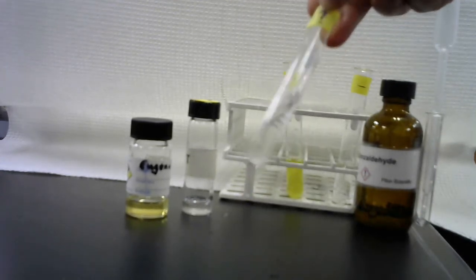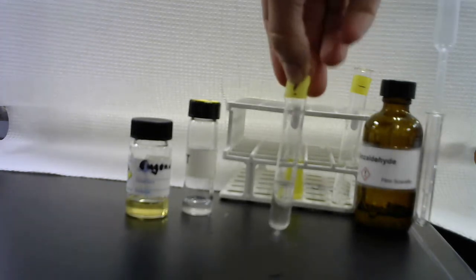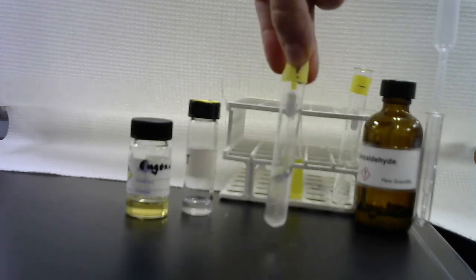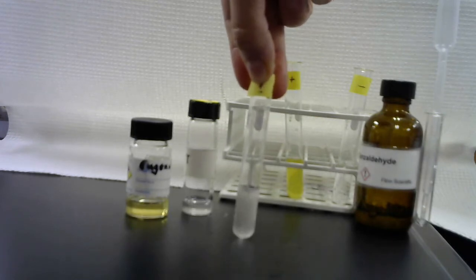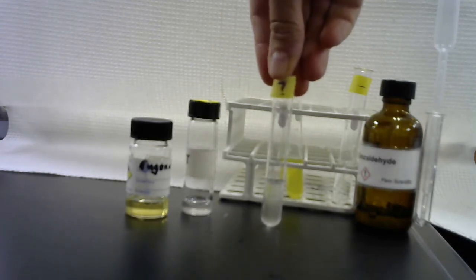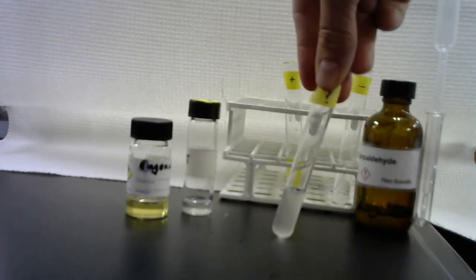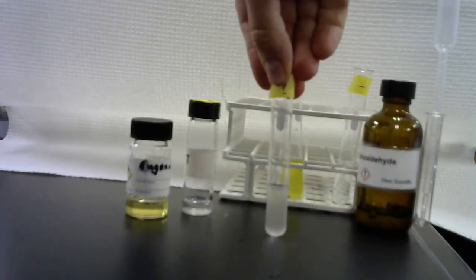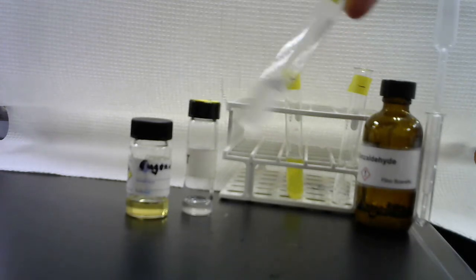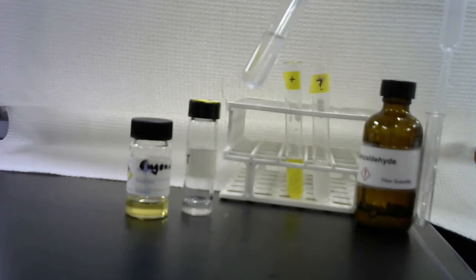Here's the unknown. Okay, that may be hard to see. Oh yeah, you can see it. See bubbles. It settles to the bottom. This unknown is denser than the solution, but when you shake it, you can see the bubbles of a different phase in the test tube. Those settle to the bottom because this unknown is denser than the sodium hydroxide solution, but it still looks cloudy. And then when the substance settles to the bottom, you can see a bubble of that liquid in the bottom of the test tube. So this unknown letter T is not soluble in sodium hydroxide solution.